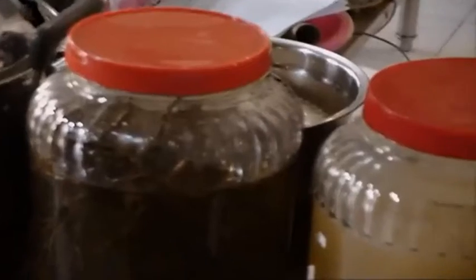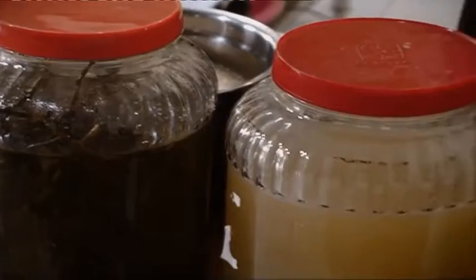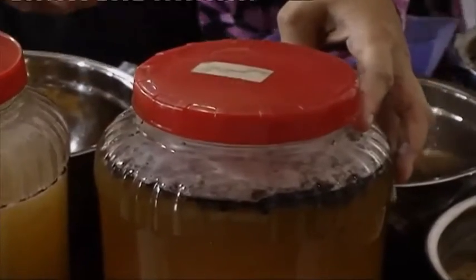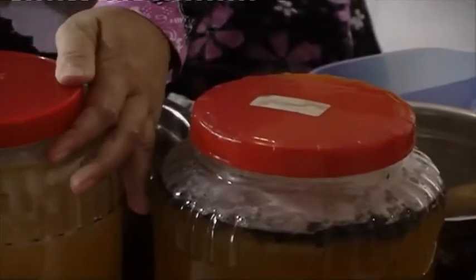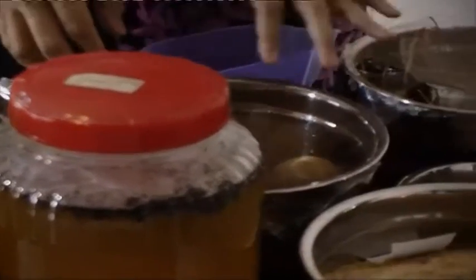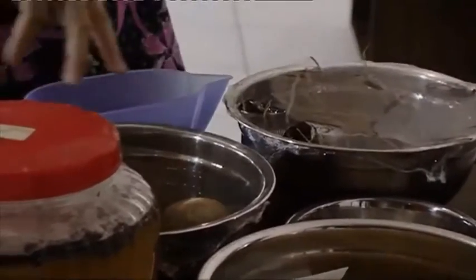I'm sorry, this is the bamboo root soak. And then if we do not clean the soil, we will have bacteria contaminated with Trichoderma. It's a beneficial fungus, but if our aim is to take only plant growth promoting bacteria, we have to clean the soil, but not wash with water. Only clean the bamboo root. Okay.